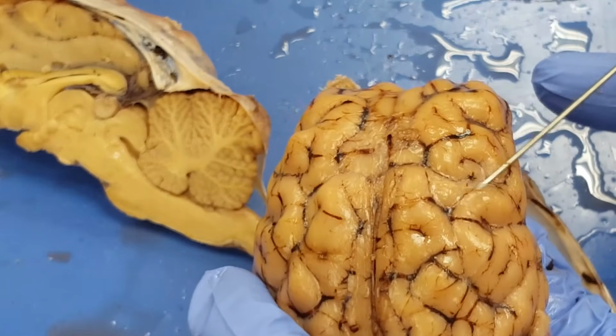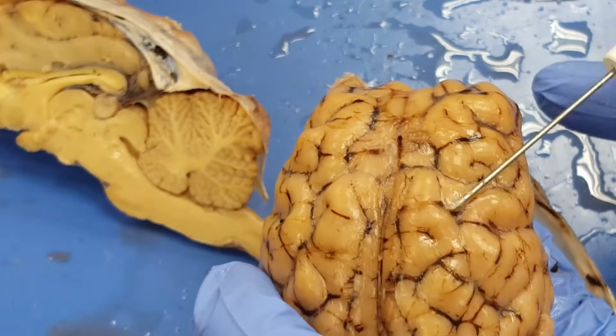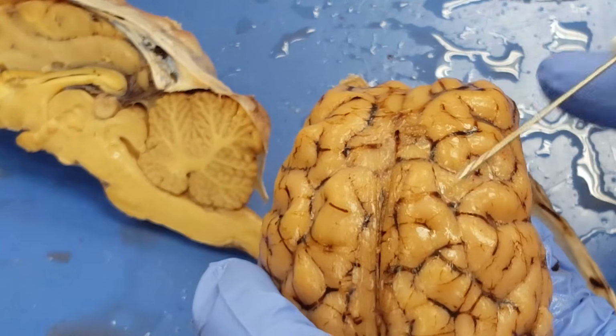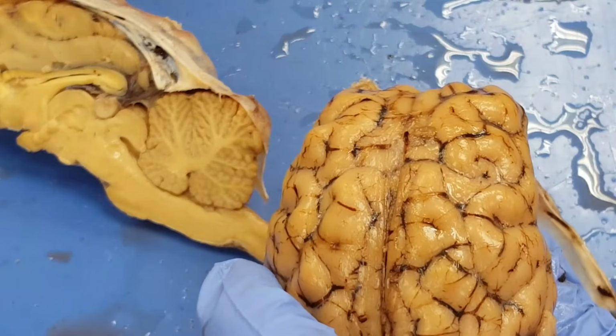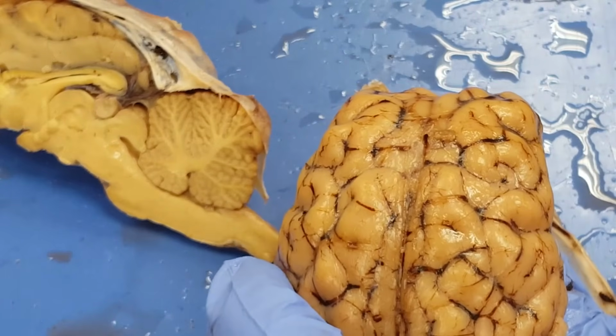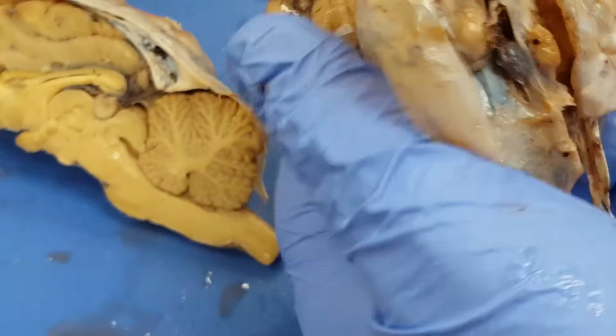Notice that there's a thin tissue covering this cerebrum right here. I'm under it right now like saran wrap. That's the pia mater, only for your lecture, but that's the pia mater. Some of the other structures I'm going to need to clean up and look at the underside of this brain, so I will do that.